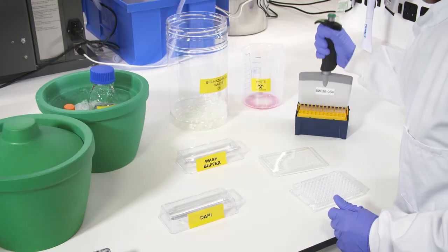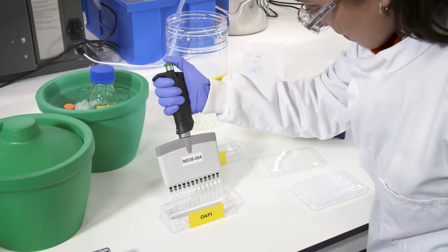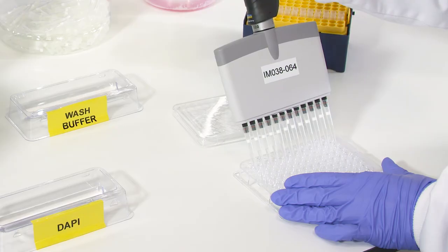Or, if your cells are being subsequently fixed, include a fixable, live, dead cell marker.